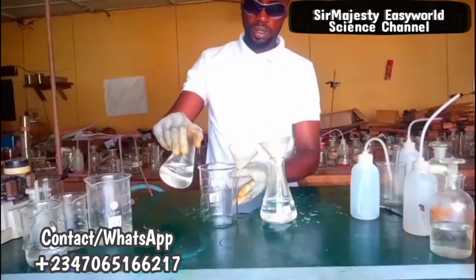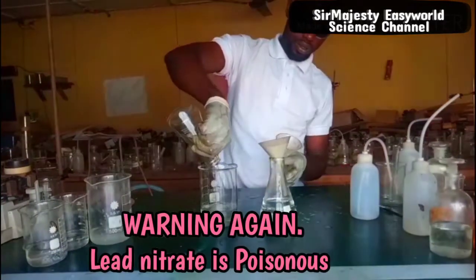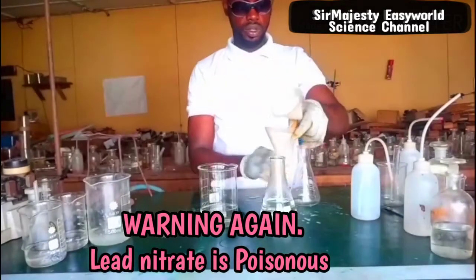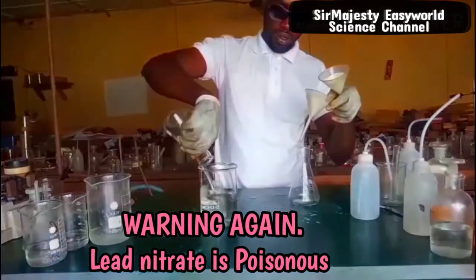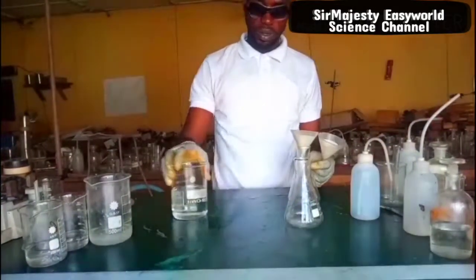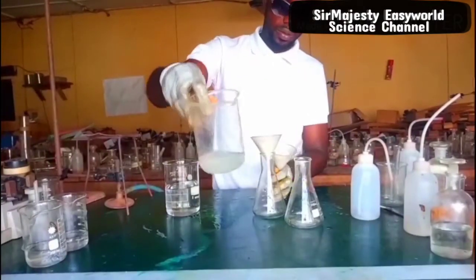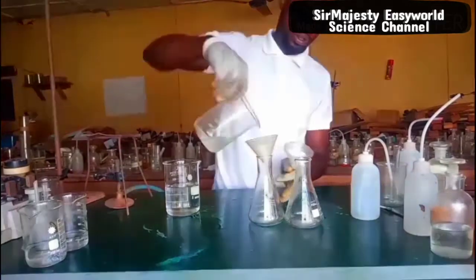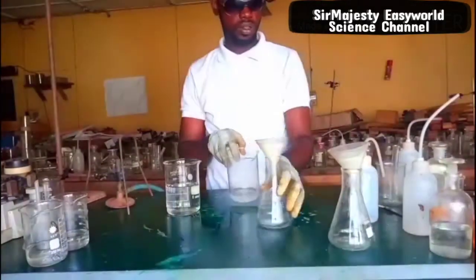Please take note that lead nitrate is very poisonous — I am repeating this because it is a soluble compound of lead. You hear about lead poisoning. The insoluble compounds of lead may be safe, but this particular lead nitrate is highly soluble and is unsafe.